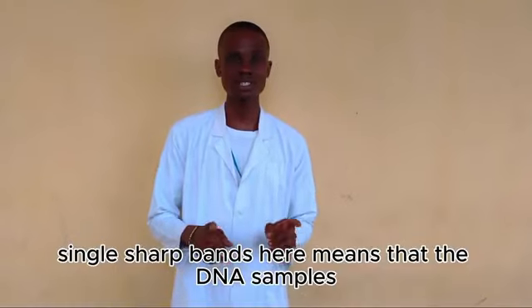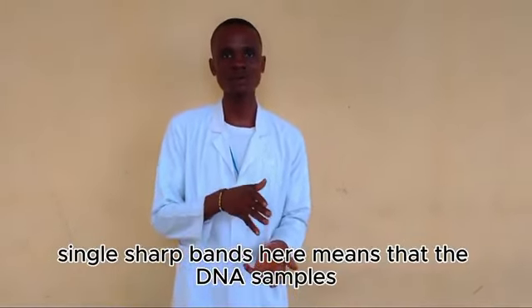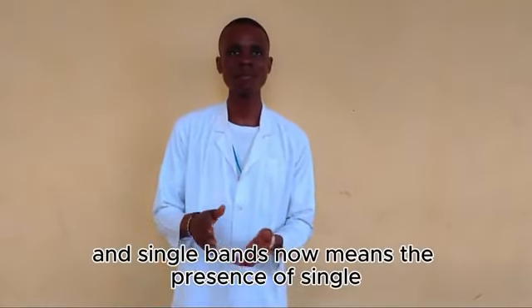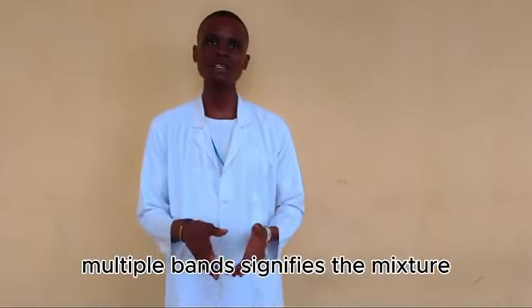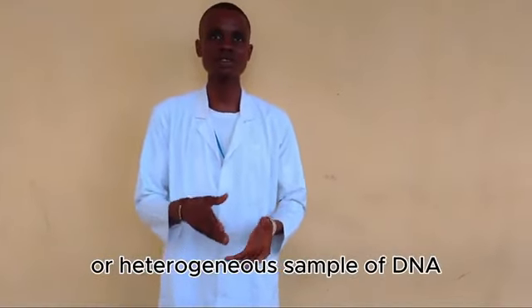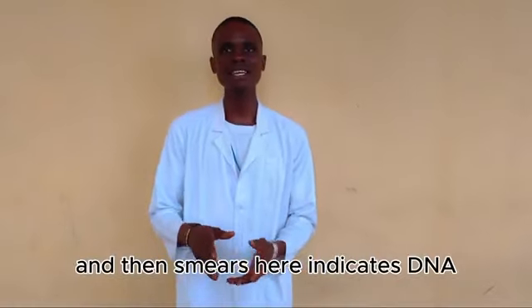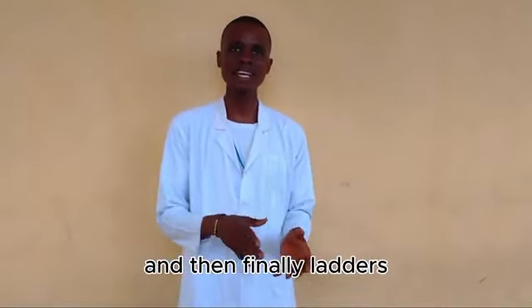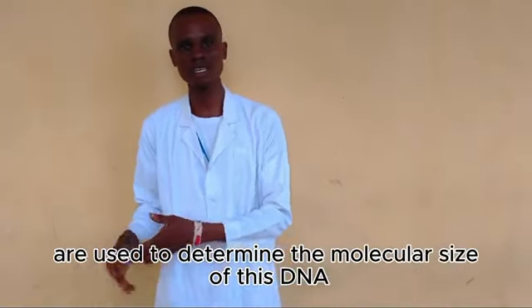Single sharp bands mean that the DNA samples present are identical, that is, the presence of single fragmented genomic DNA. Multiple bands signify a mixture or heterogeneous sample of DNA, and smears indicate DNA degradation or contamination of DNA. And then finally, ladders are used to determine the molecular size of this DNA.